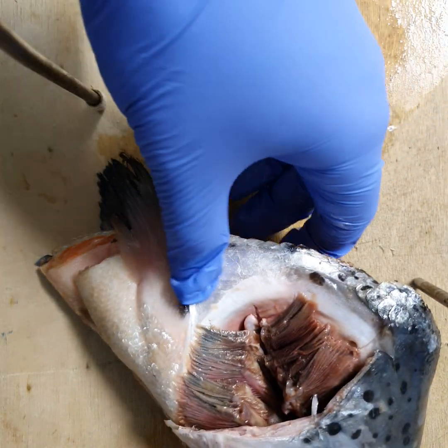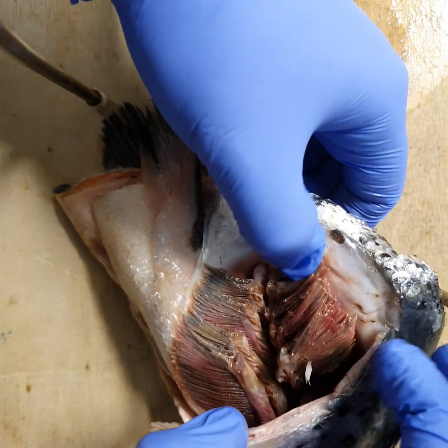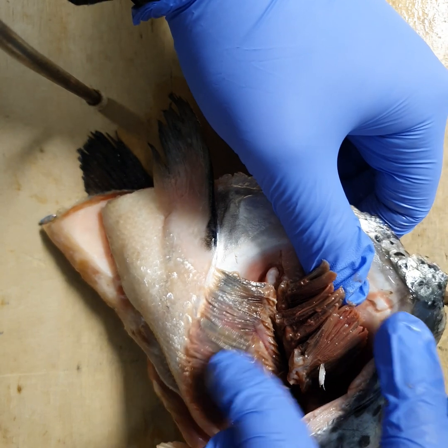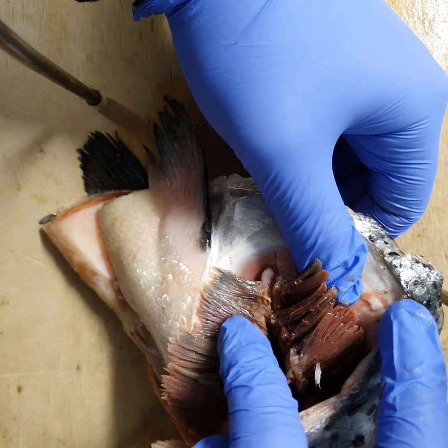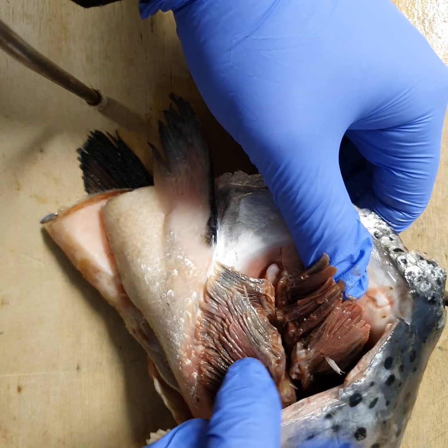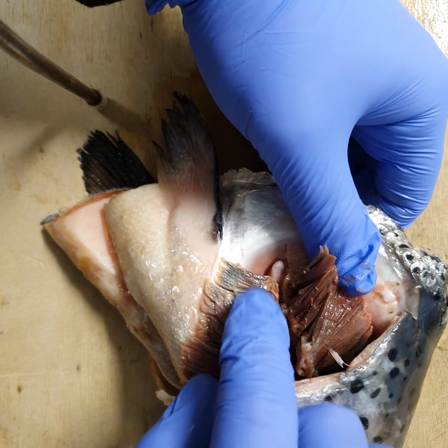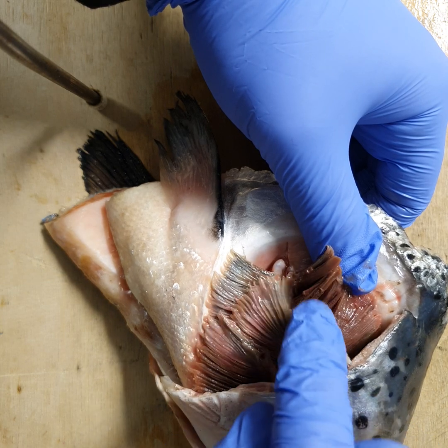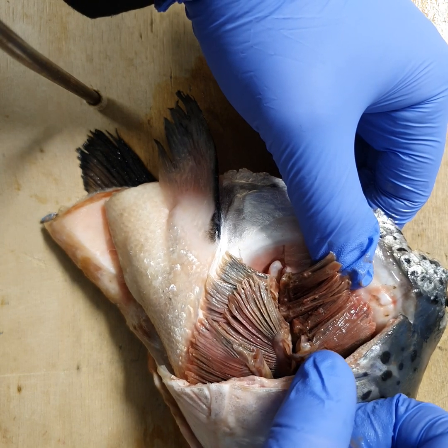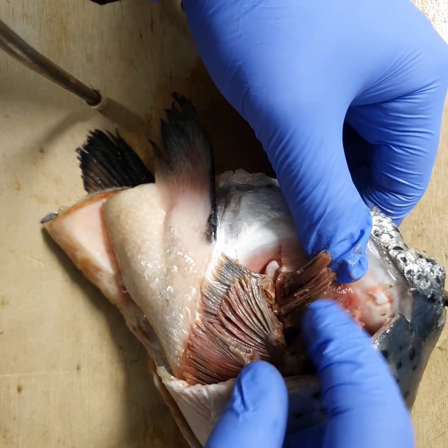When we open it up, we find the gill plates lined up against each other — one plate here, another one here, another one here. All of these are covered by gill filaments which protrude from the bony gill arch in the center. All of these filaments and gill plates together contribute to a massive surface area.